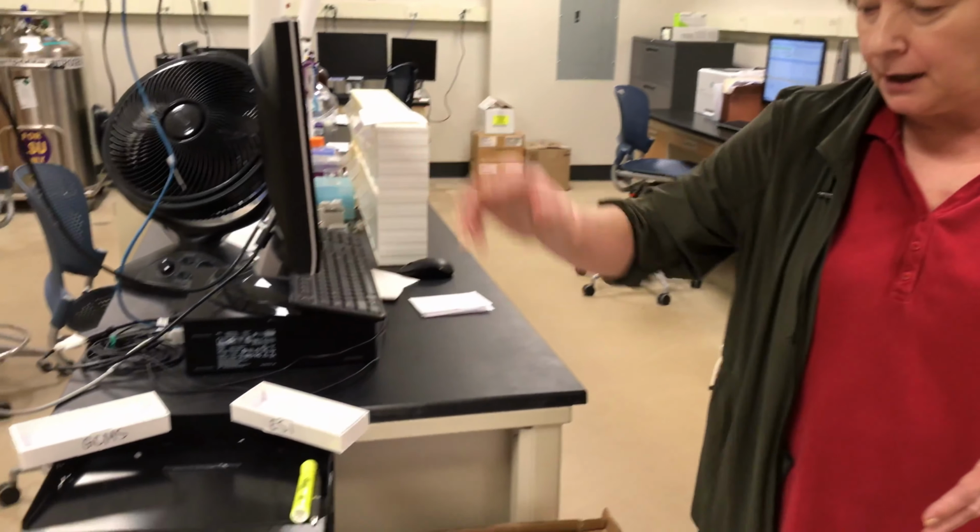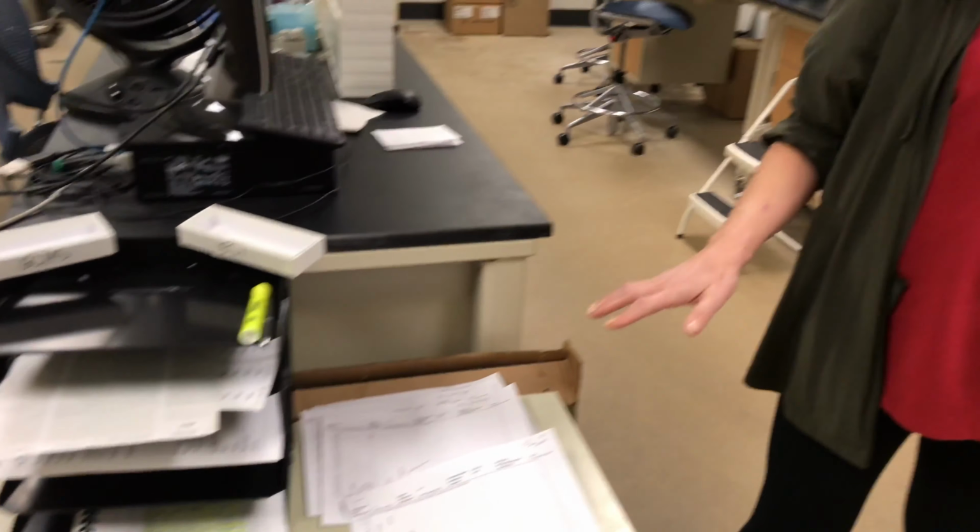Hi, this is where you might come to submit a sample if you needed to know the accurate mass of your sample. If you were to come into my lab, you would come to this little station, get a label, submit your sample, sign a submission form, and then I can run your sample, or if you want to learn to become a user, I could teach you to run your own sample.